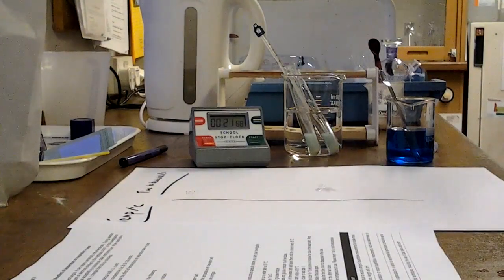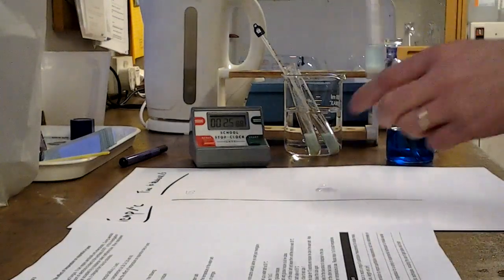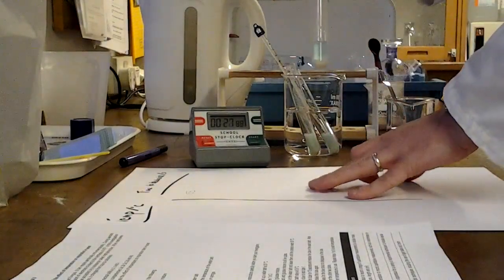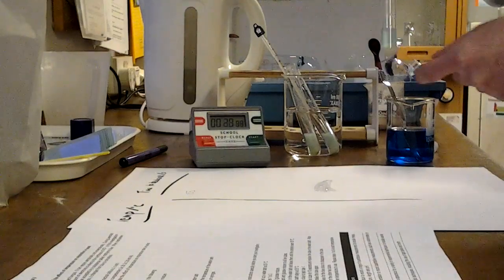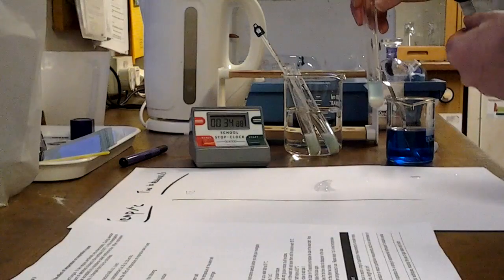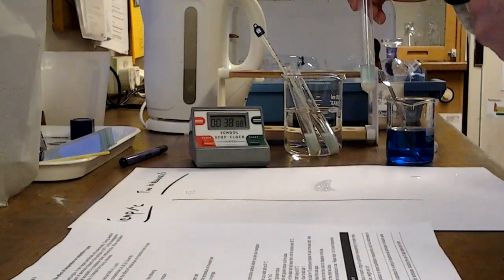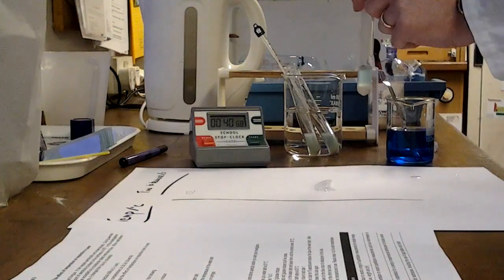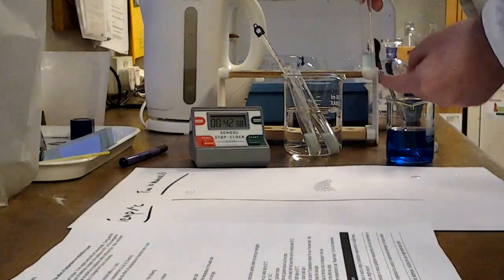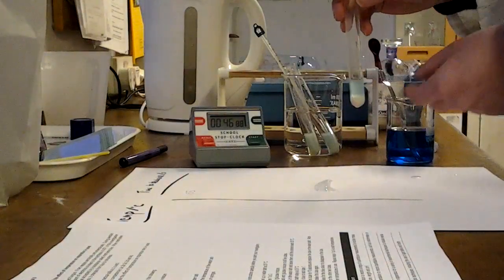This is the one that's finished here. And as you can see, it's not completely decolorized. There's a bit of blue at the top, and there's the reason for that. Remember, methylene blue, when it's reduced, it goes colourless, and the opposite of reduction is oxidation. So if it gets reoxidized, it will go blue again. And the top of the tube is coincidentally where oxygen is available. So you're never going to get that bit of colour disappearing completely.